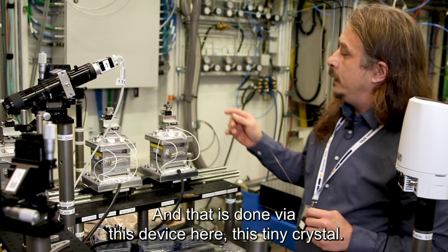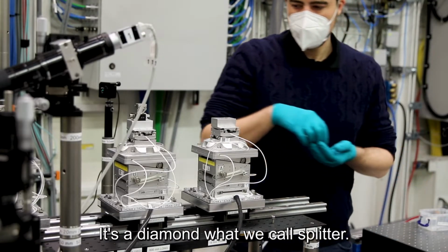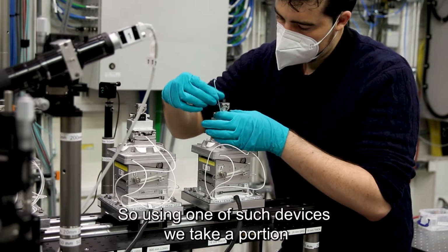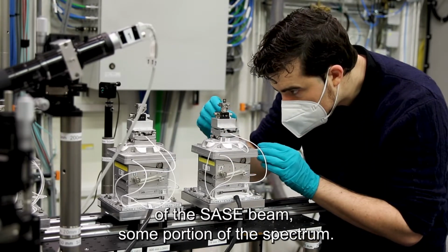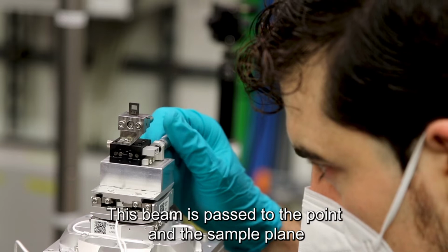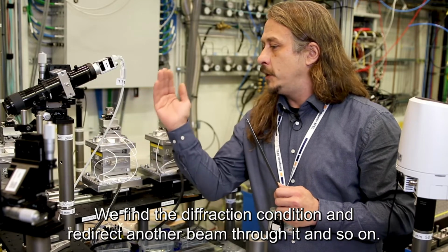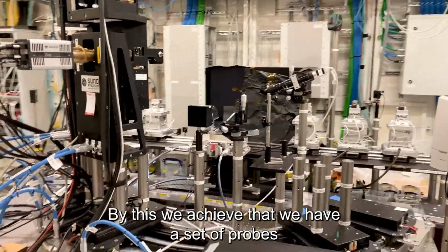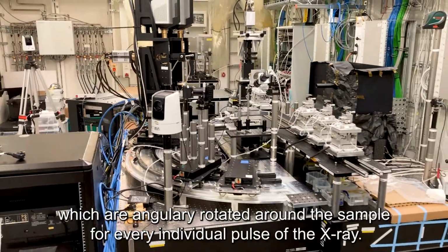And that is done via this device here, this tiny crystal. It's a diamond, what we call a splitter. It operates either in transmission or reflection geometry. So using one of such devices, we take a portion of the SASE beam, so some portion of the spectrum. This beam is passed through the point at the sample plane, and then we take another crystal which is placed at a different position. We find the diffraction condition and redirect another beam through it, and so on. By this we achieve a set of probes which are angularly rotated around the sample for every individual pulse of the X-ray.